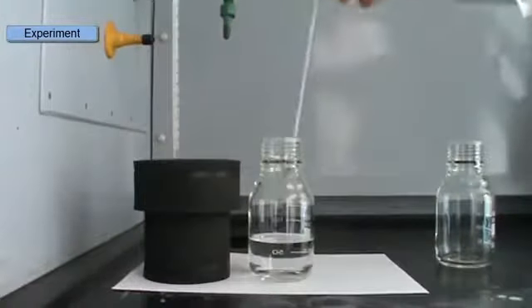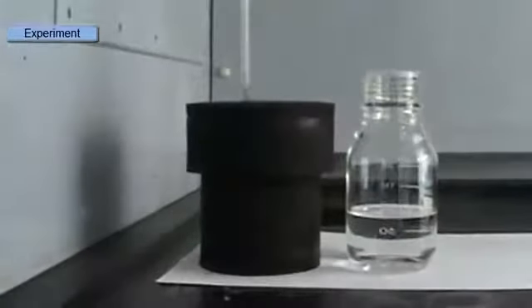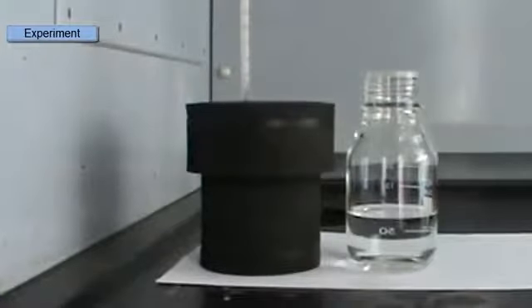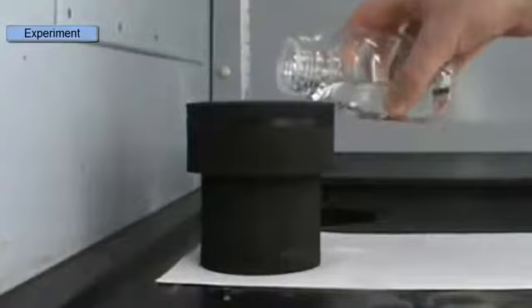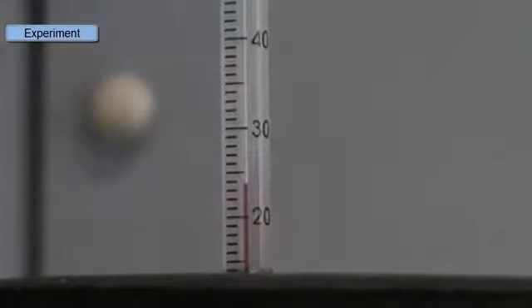Now I can pour in my acid, and as this reaction proceeds, it's going to form salt and water and it's going to give off heat. So that heat will obviously increase the temperature of the solution. So we'll pour in our acid, and after pouring in and mixing, we'll note the final temperature. So we watch the temperature increase, and when it levels off, that's the final temperature. So here I've mixed it for a while and now it's at 24 degrees.